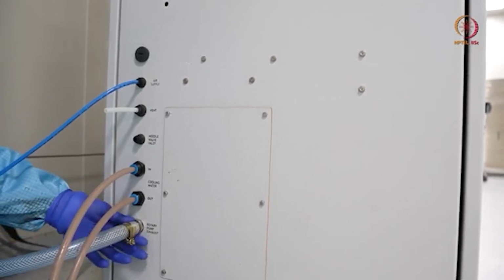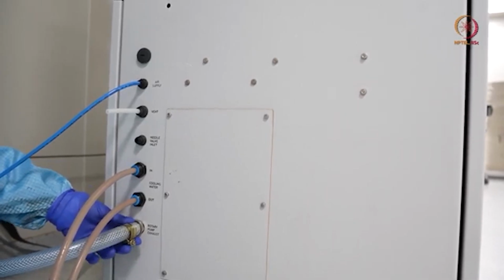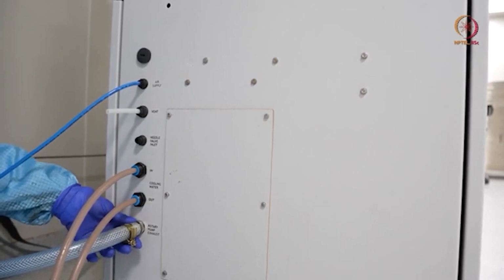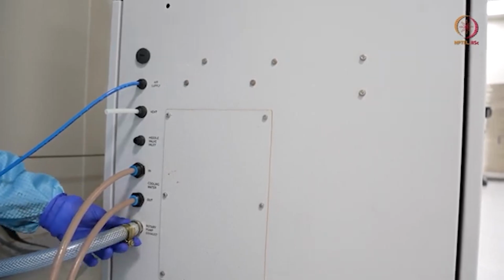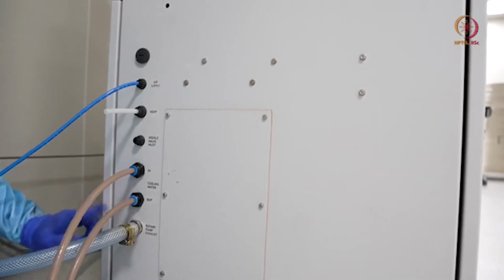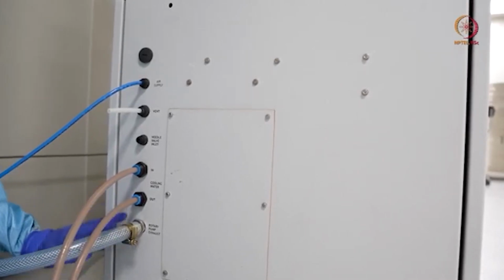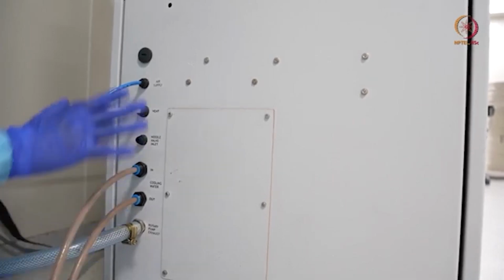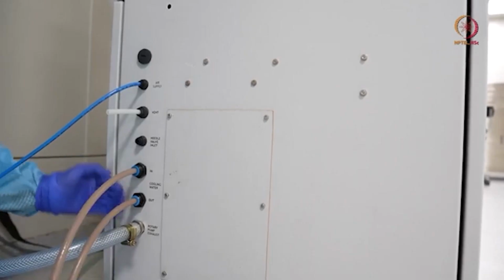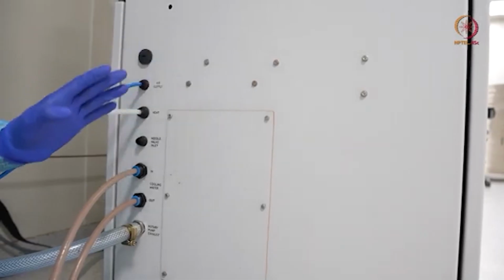So this is the rotary pump. Usually when the rotary pump works, it will have some exhaust. That exhaust can be oil based or just an air outlet. Whatever the exhausts are, we are taking them out and keeping them outside the clean room, because they may contaminate our clean room environment. So these are the things that are connected directly to the chamber. Now we will focus on the other units as well.